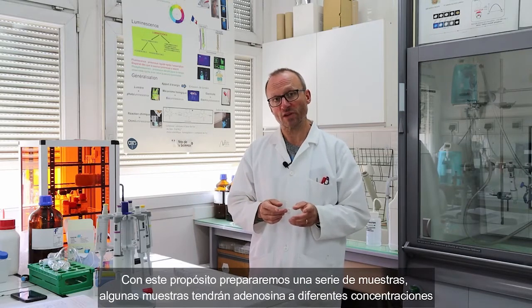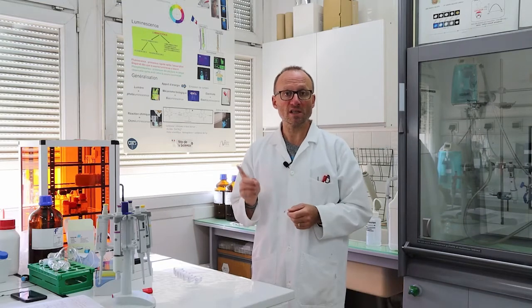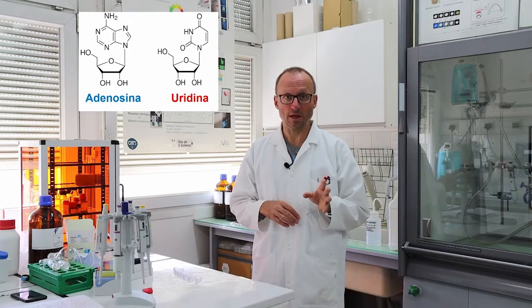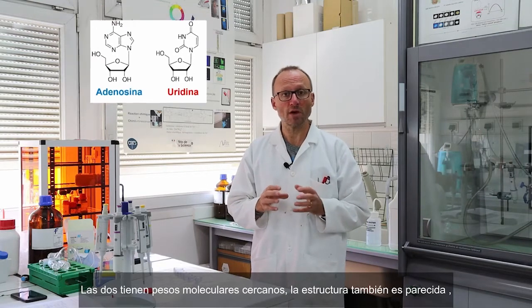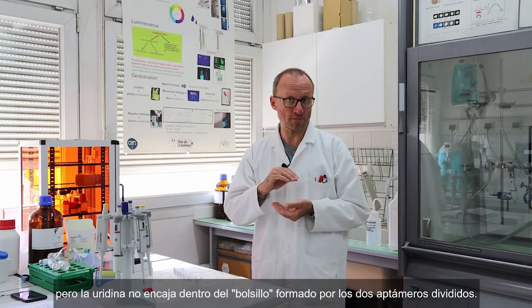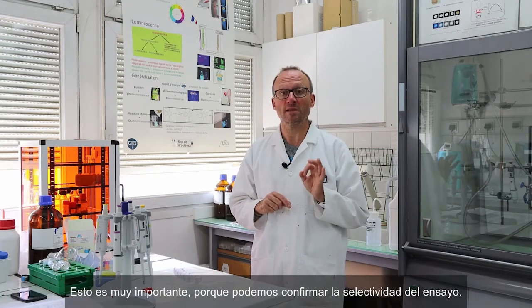Some samples will contain the adenosine at different concentrations. One sample will contain the uridine. So uridine is a small molecule. It looks like adenosine, but it's not. Okay, so it has a similar molecular weight. The structure is very close, but it will not fit into the pockets that will be formed by both split aptamers. Okay, this is very important. It will ensure that we can test the selectivity of the assay.